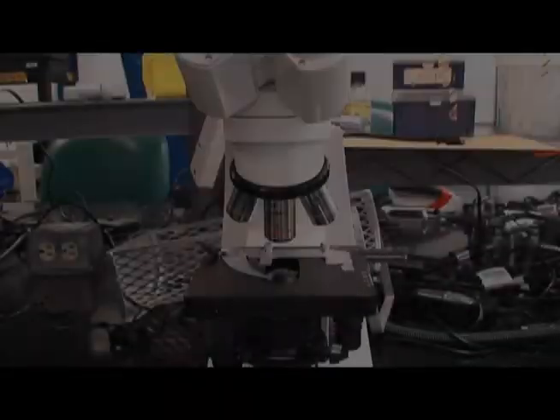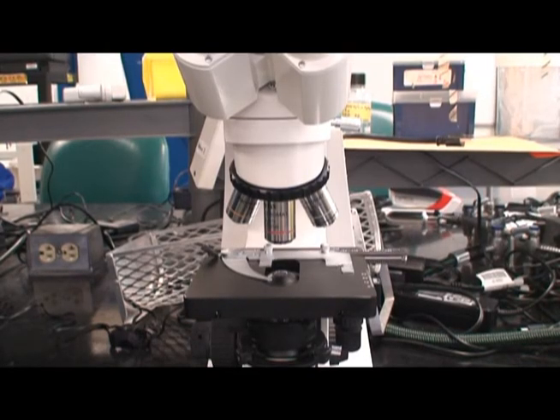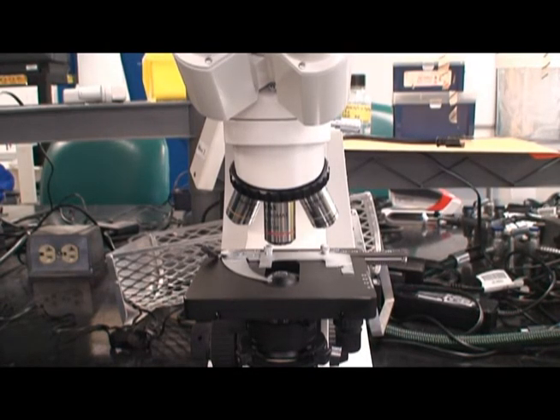Allow the smear to air dry and then examine under oil immersion. If unfamiliar with the proper use and function of a microscope, review the video How to Use a Microscope.